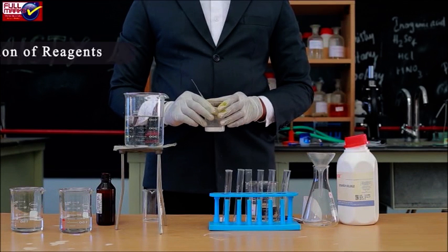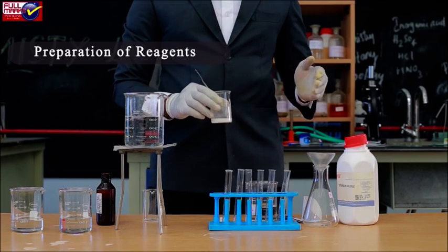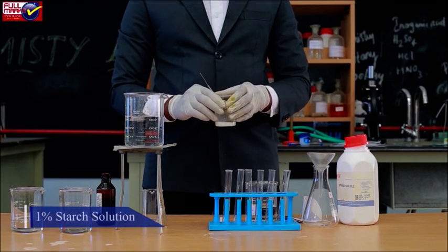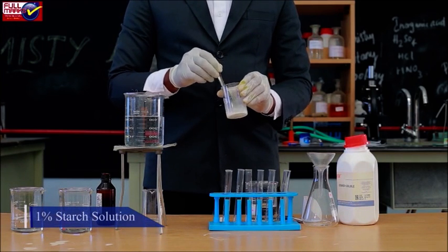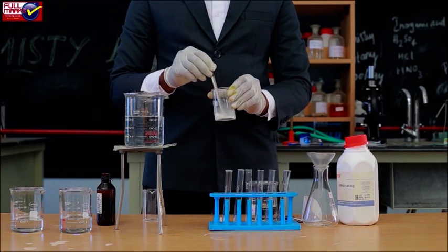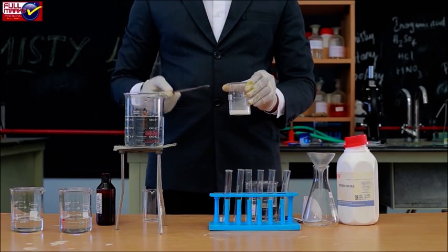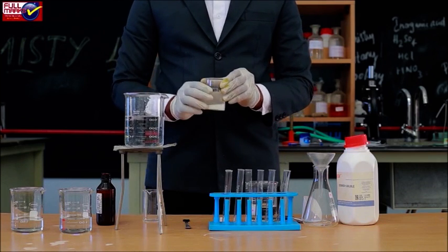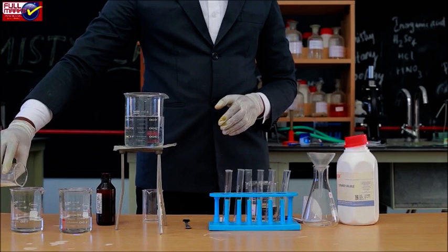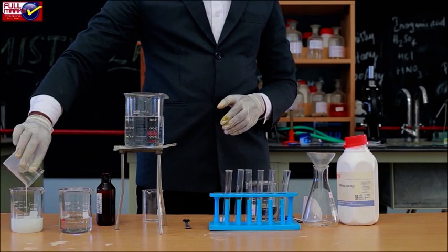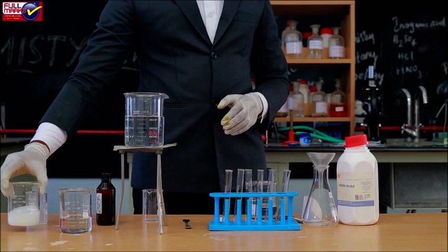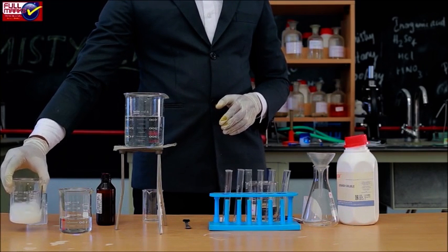Preparation of reagents: 1% starch solution. Add 1 gram of soluble starch in 10 ml of distilled water to make a thick paste. Add 10 ml of this starch paste in 90 ml of distilled water and boil it along with gradual stirring. Leave the solution for 12 to 14 hours and then filter it to obtain 1% starch.